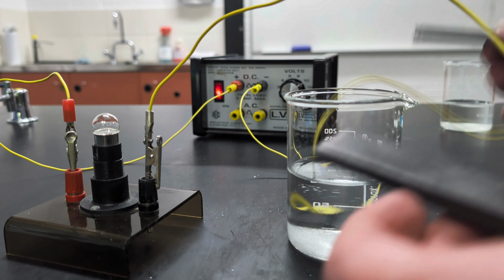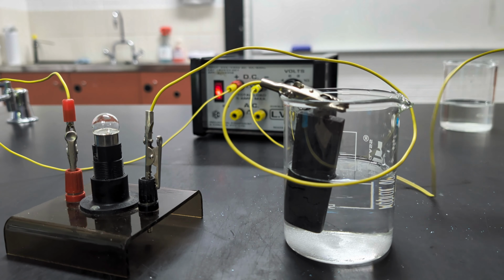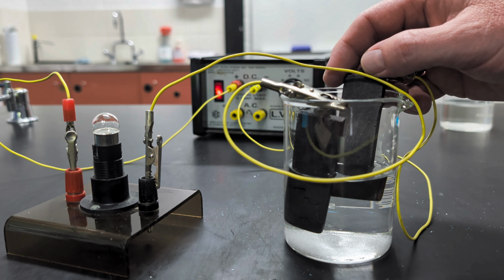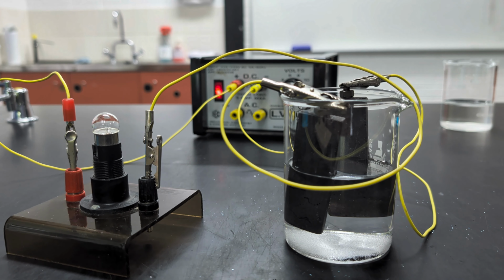Well, testing our circuit, touching the electrodes. Yep, we're good to go. Let's put the electrodes in the solution. We'll dip one in, and then I'll touch the other in, and watch what happens to the lamp. Hold up, nothing happens. Touch the electrodes, complete the circuit. Now, we said before that when we dissolve ionic compounds by putting them into water, we have ions that are free to move through the solution, and therefore that's a flow of charges, which is electrical current. And yet we don't have electrical current flowing now.